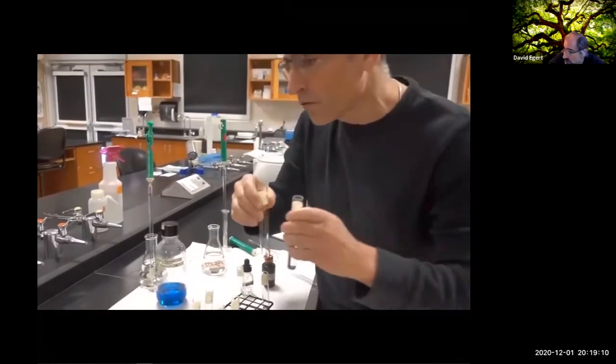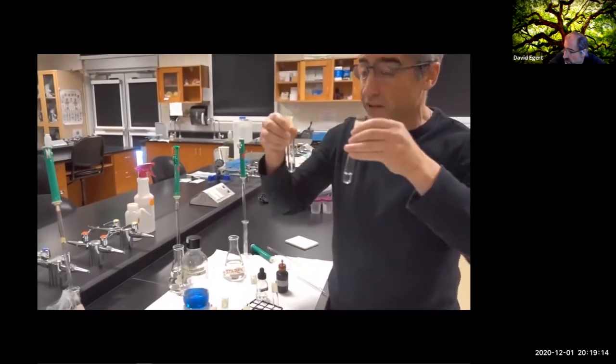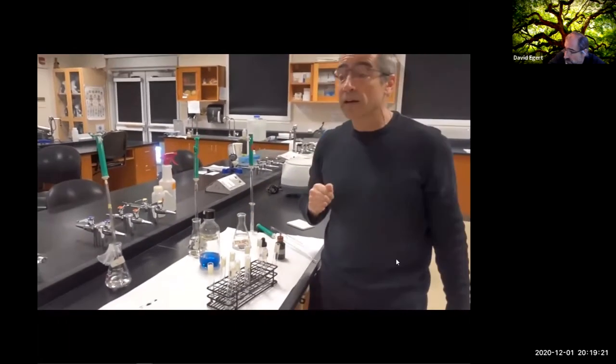This was pure starch before. So when we do our test, this should show up positive for starch. It should not show any maltose. This one here is pure maltose, so we do the test for maltose. This should be positive for maltose, but have no starch present. That's how we're going to know our test is trustworthy.